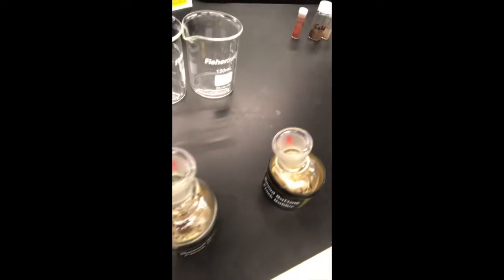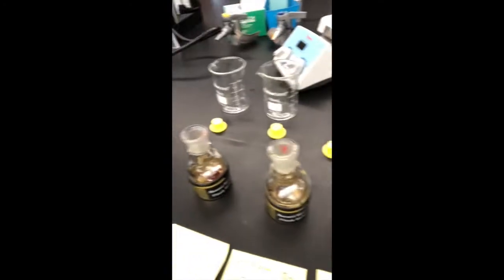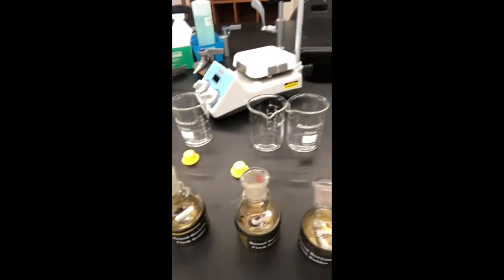Okay, so now we've got catalyst and LPTS in all of these vials, except of course for the control, which just has LPTS in it, so no catalyst. So again, the control should be everything except for what you're evaluating. In this case, that is the catalyst. So everything will be identical except for the presence of that cobalt catalyst.